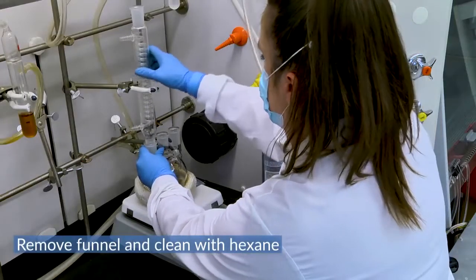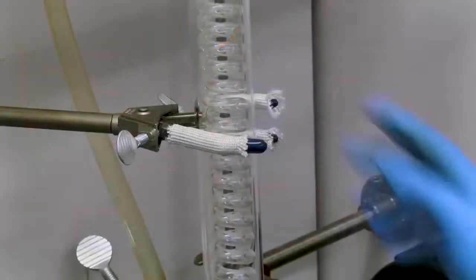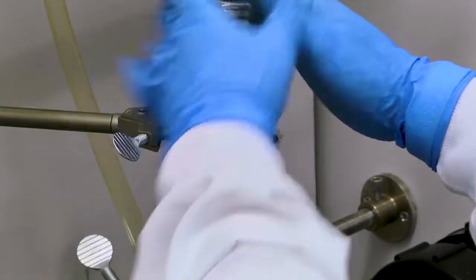Attach a condenser to the left neck of the flask and use a metal claw clamp to secure the condenser to the flask.